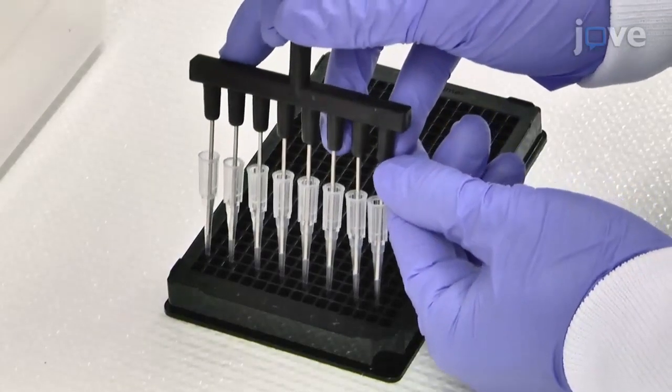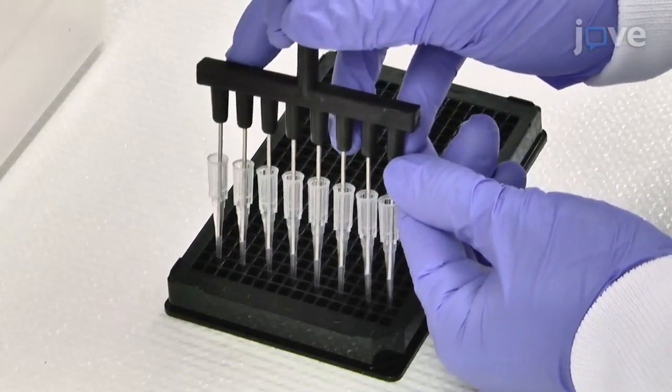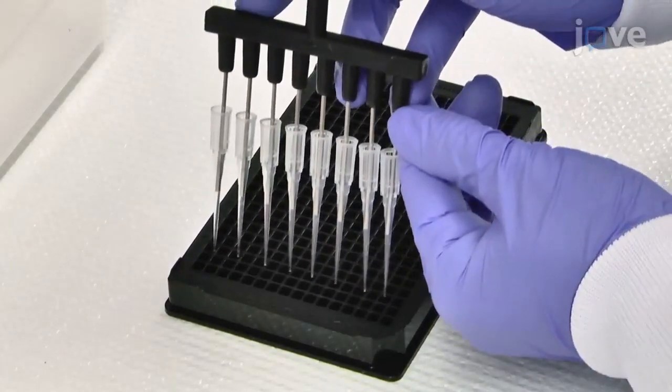Make sure you prepare a plate map and gently add and aspirate liquid from each well of the plate to keep cell number and immunostain conditions consistent between the cells. This will yield a high Z factor and reliable results.